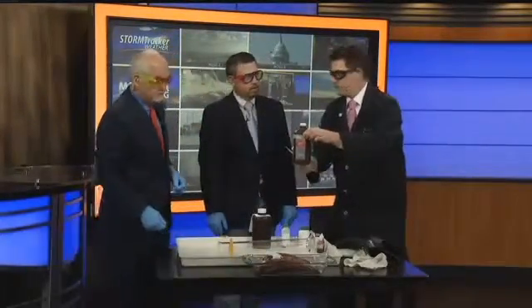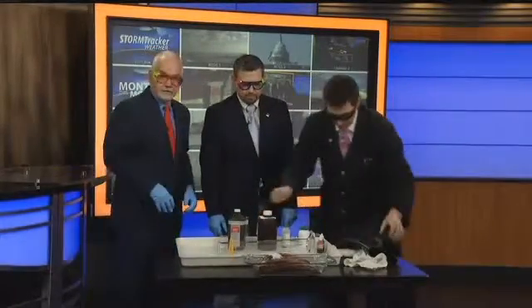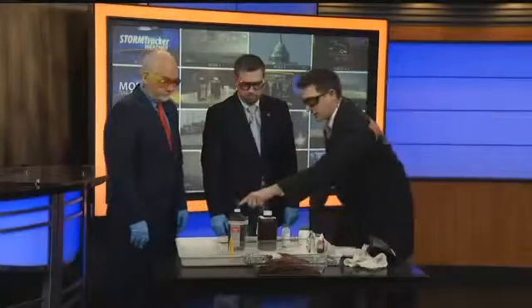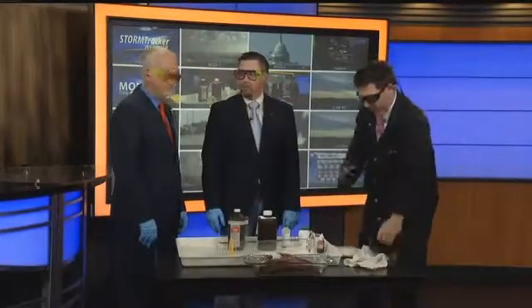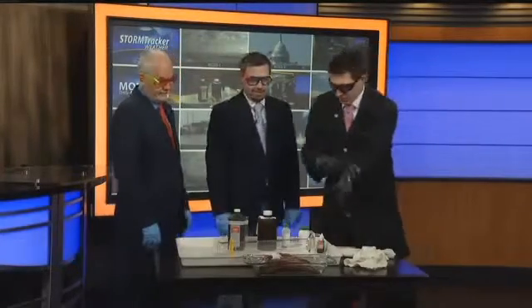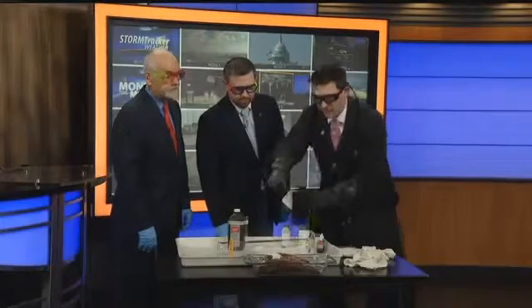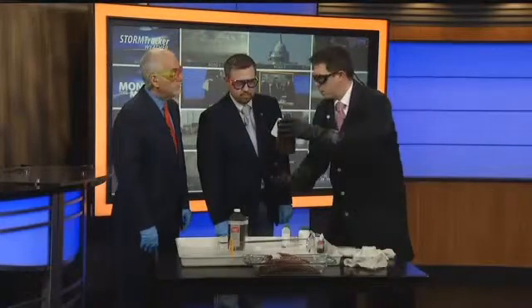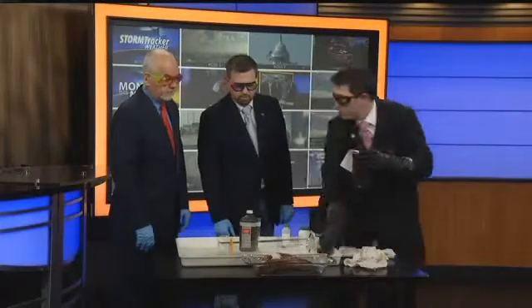This is the stuff that mom uses — that's the low-grade stuff. This is the stuff we use in the lab. This is 3% hydrogen peroxide; this is 30%. That's why we've got the great gloves on — it's a little revved up. Now, the reason it's in this cool bottle is it's constantly decomposing, and when it does, it's fizzing up, which means this bottle will grow. If we had it in a regular bottle, it would potentially just burst.